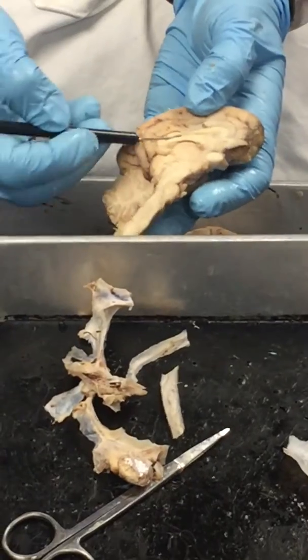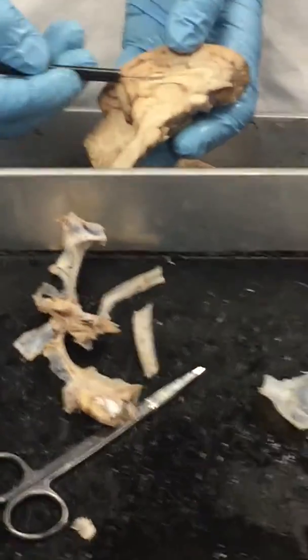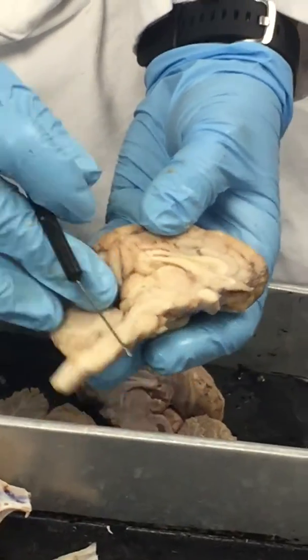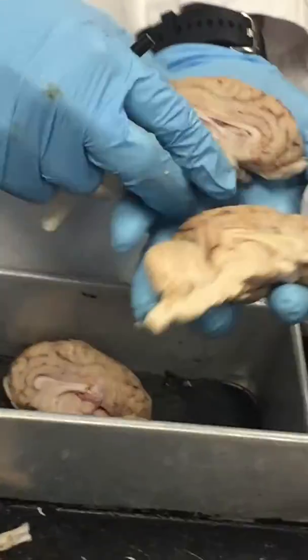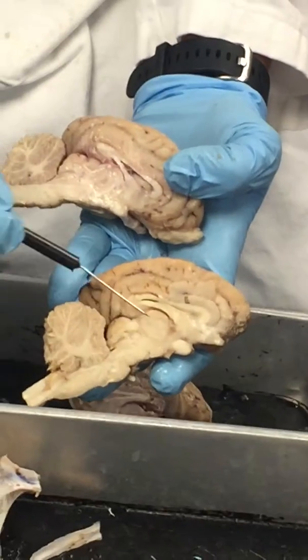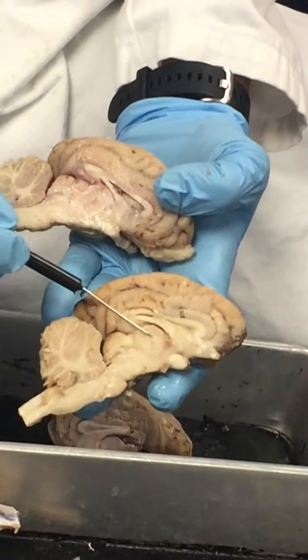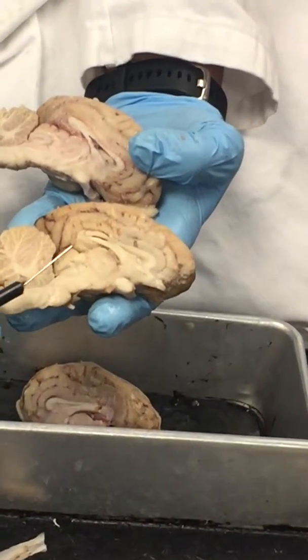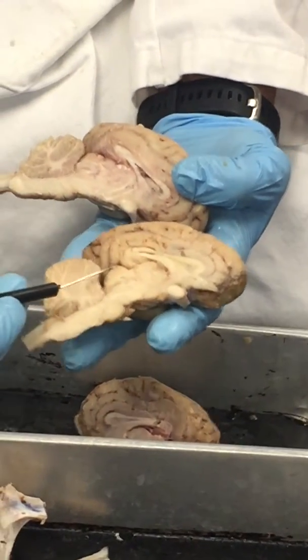Again, this is that lateral ventricle. Here's that septum pellucidum that I just poked the pin through, right? But right there, all that septum pellucidum. What's nice on this one that I was not seeing a lot of here is this very round thalamus, okay? So this is that thalamus inside there, which means the epithalamus sits on top, where we're going to have that pineal gland.